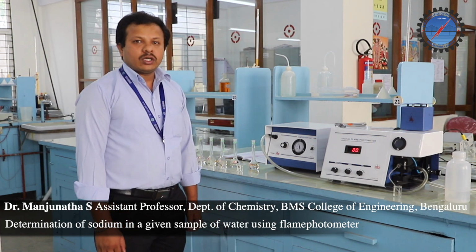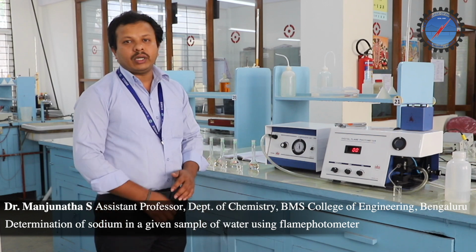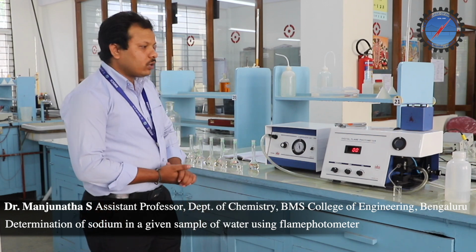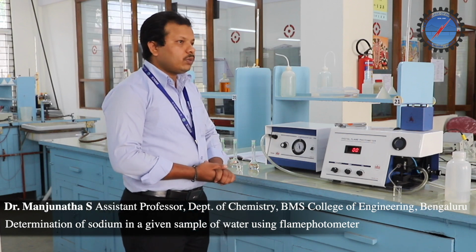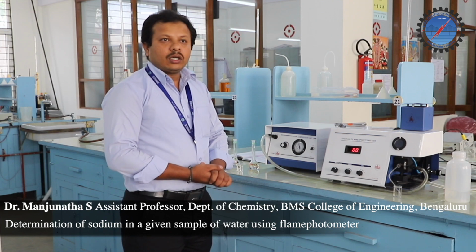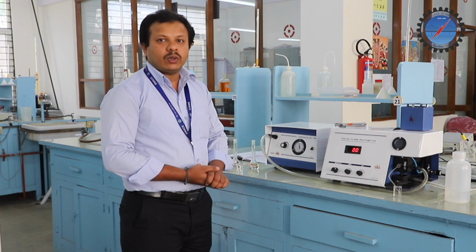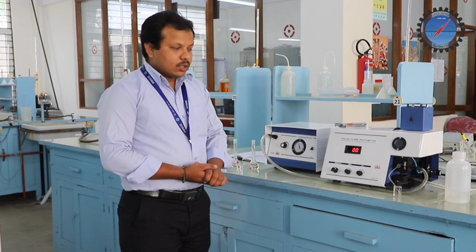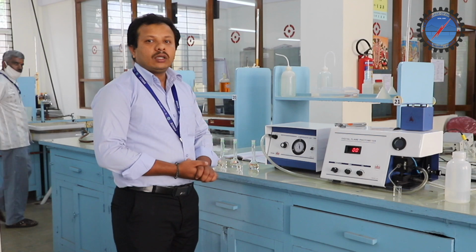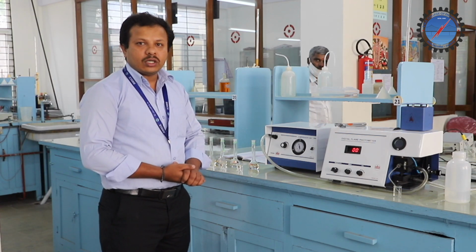Today I am going to demonstrate one of the instrumental methods of analysis, that is flame photometry. Flame photometry is an important spectroscopic technique to determine the dissolved alkali or alkaline earth metals present in the given water samples. Let us see how to determine the presence of some alkali metals. Especially, I am going to demonstrate the determination of the presence of sodium in the given water sample.